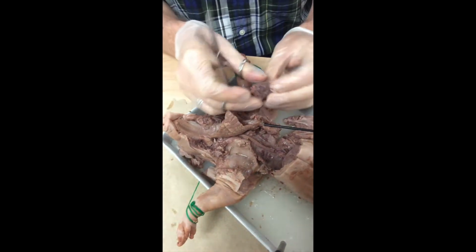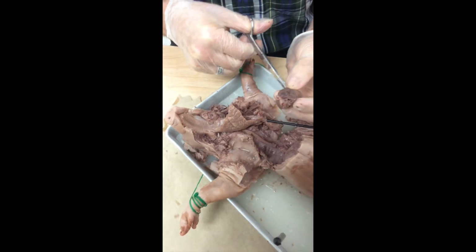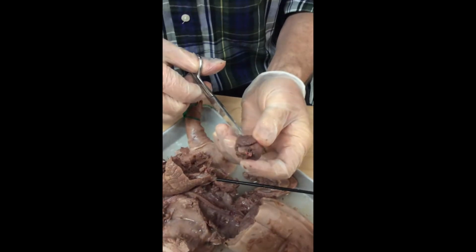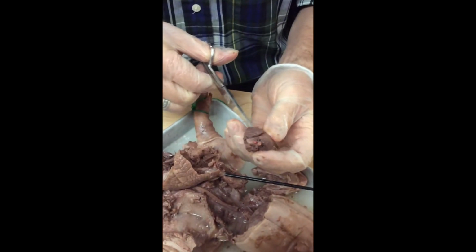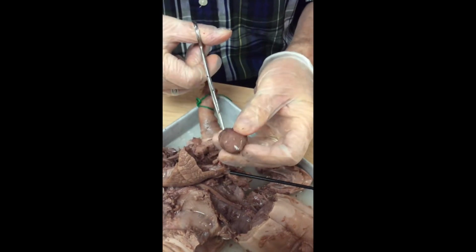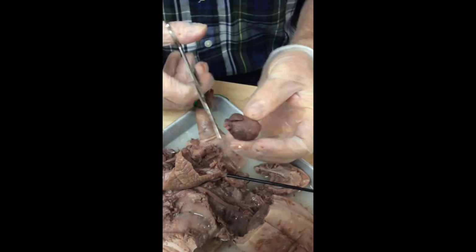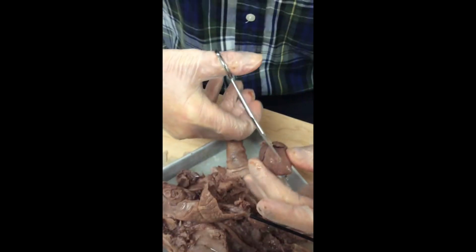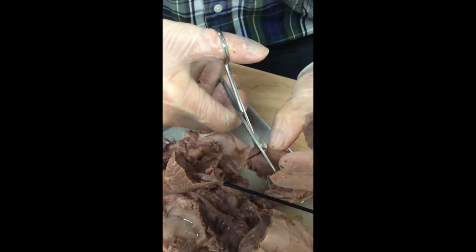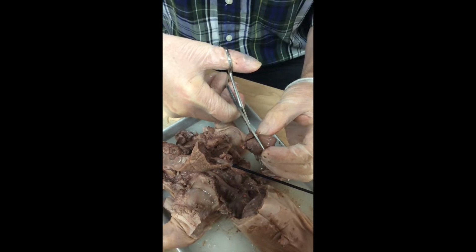And once I've done that, we can see a couple of structures laying on top of the heart. These look like ears on the heart, and by golly, the term auricle is used to identify them. Auricle means ear. So we've got two auricles, and in the lower muscular part of the heart, we have two ventricles. So I'm going to have you cut through the heart, cut the auricles off the top like this, so you can look inside there. I'm not going to show you that because I want you to have this experience.